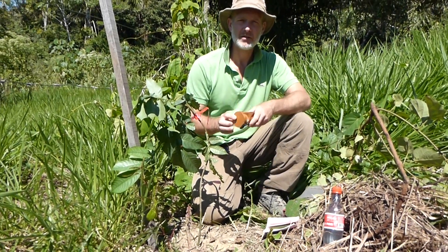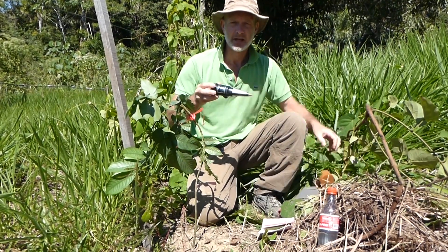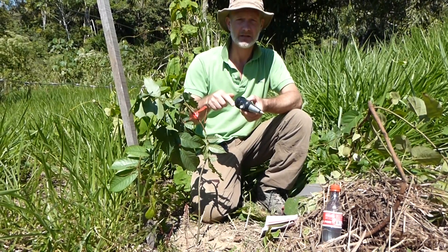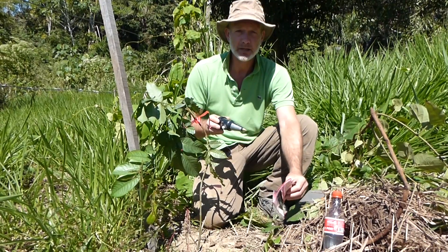This is a quick clip to show you how to use the soil pH meter we're using here. This is a Kelway meter which measures the conductivity to work out the pH. It's called a Kelway and the model number is HB2.